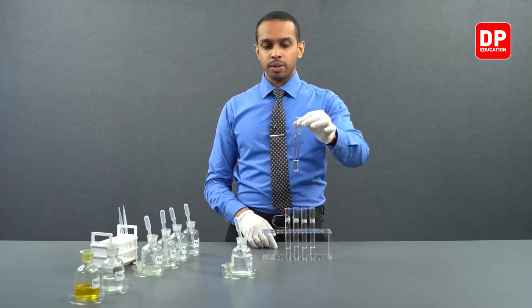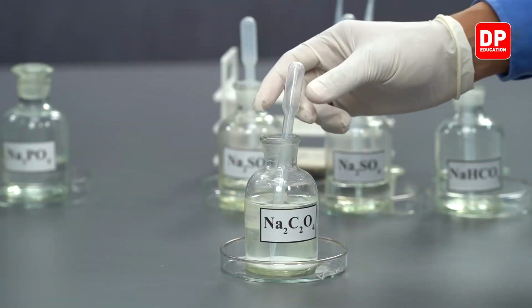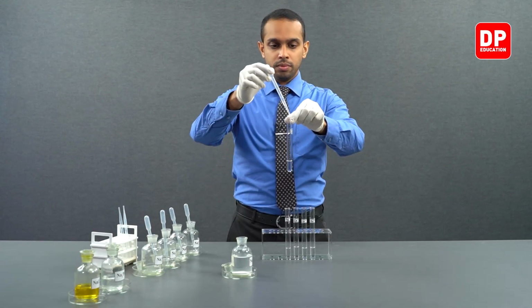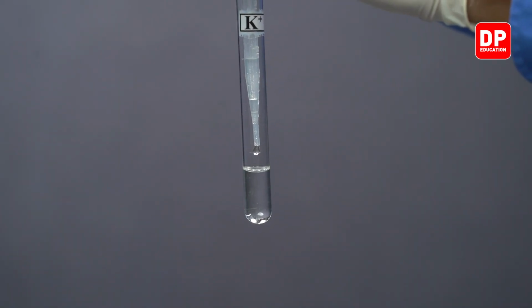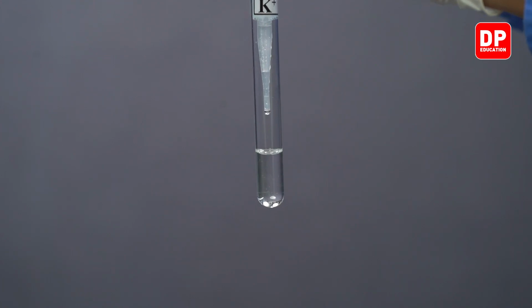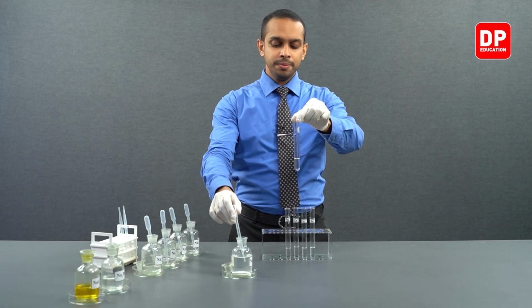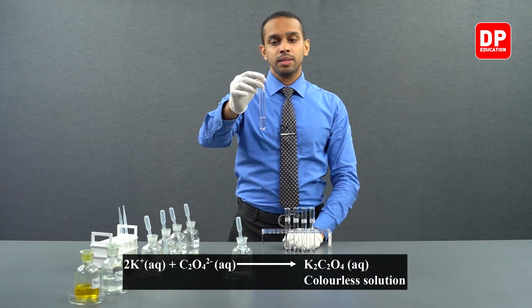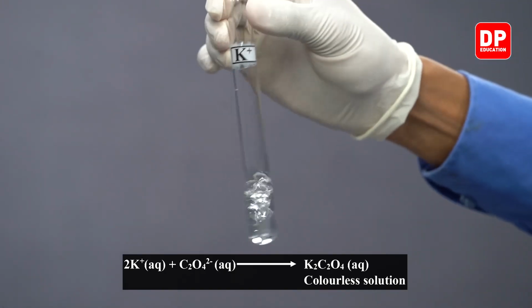So we have our potassium 1+ aqueous ion solution here. And let's see what happens when a drop of oxalate anion solution is added. As you can see, when you add oxalate anion, you do not see the formation of a precipitate.